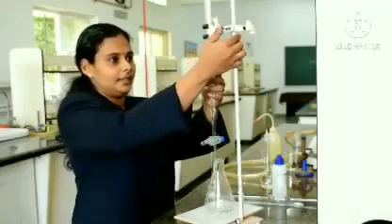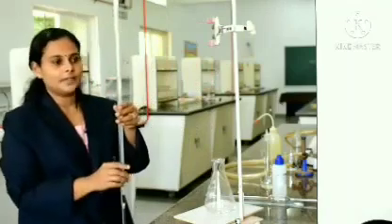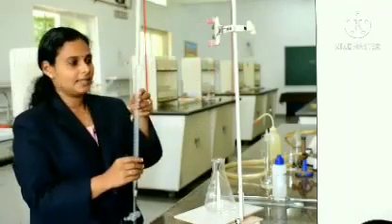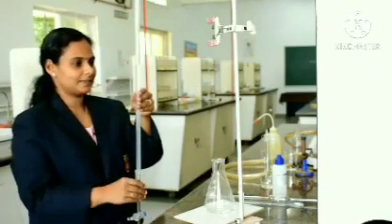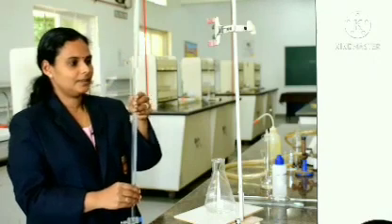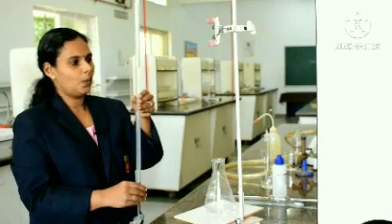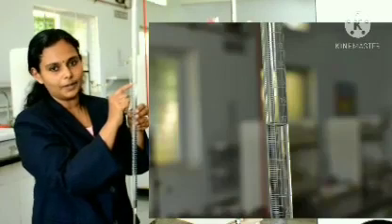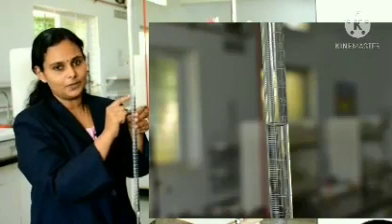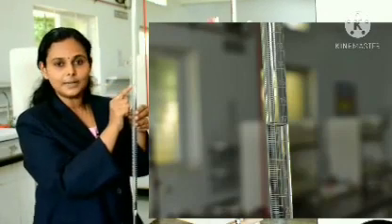Now, to take the reading, take out the burette in your hand. You could see the level. So, whenever you are seeing the scale, see that you keep the level parallel to the eye. Now, it is coming about 17.1. So, you have to count from the top, that is from 0 it has come to 17.1. So, this scale is of 0.1 graduation. So, it gives about 0.1 difference. So, this value is 17.1 ml. This is how we do the titration.